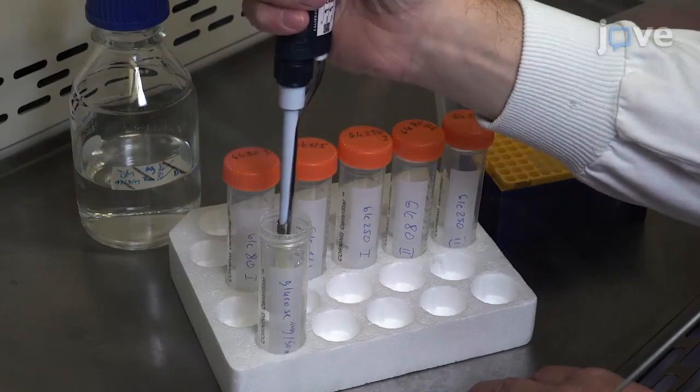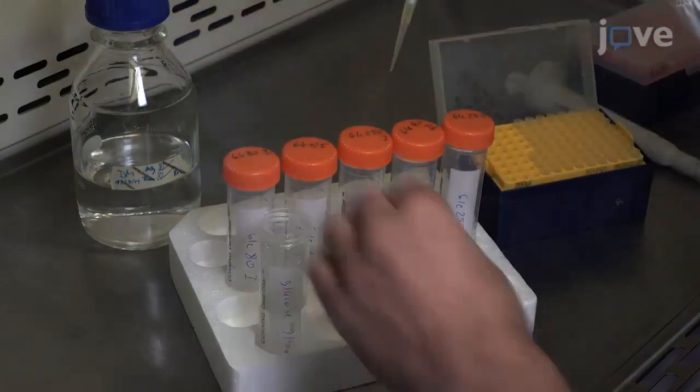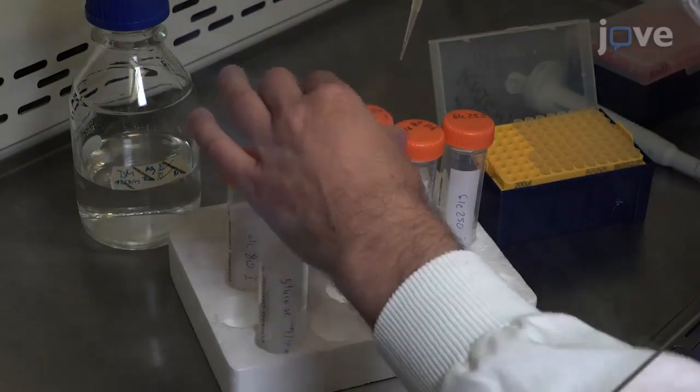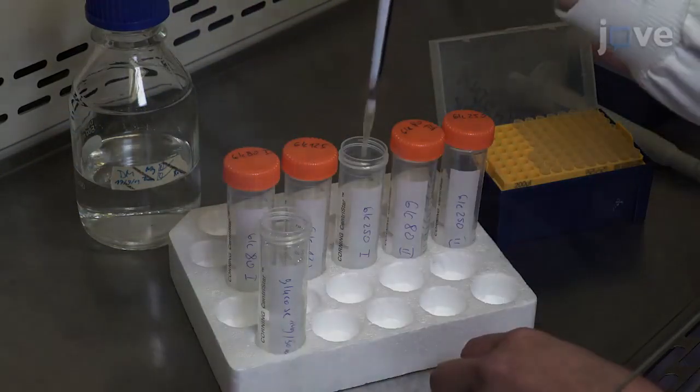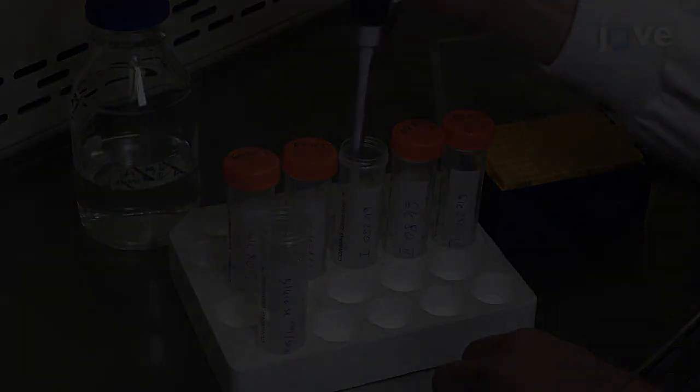Prepare 22 milliliters of five different solutions of liquid Davis minimal medium with glucose, each in its own 50-milliliter tube.